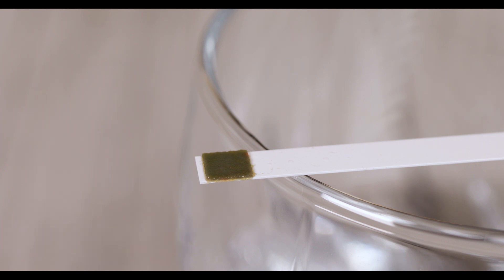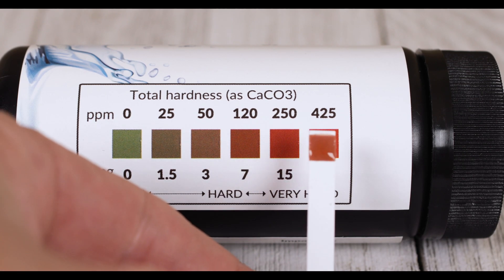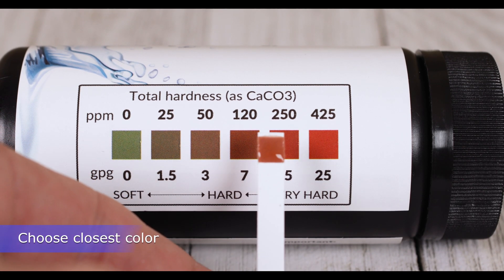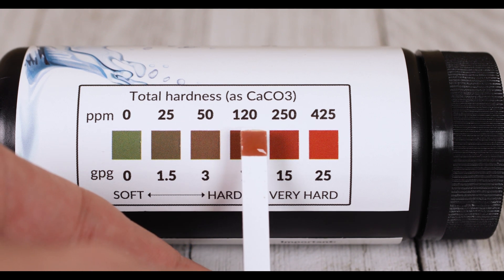Allow the color to develop for 30 seconds, then immediately compare the test pad to the color chart. Select the closest color match within two minutes, then discard the strip.